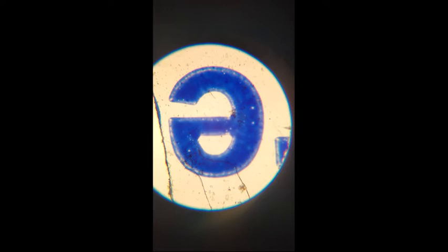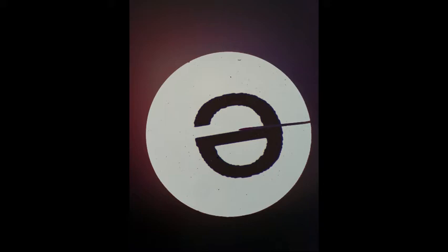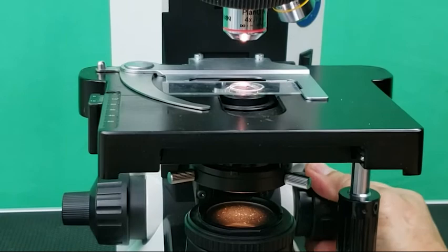Make sure the letter E is centered on the microscopic field. Now, rotate the nose piece until the 10x or low power objective clicks into place. Do not adjust the stage before rotating the nose piece.